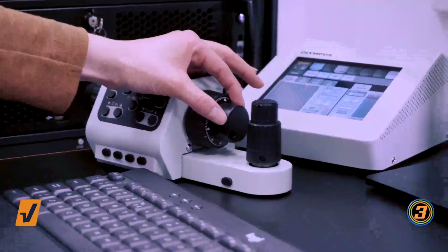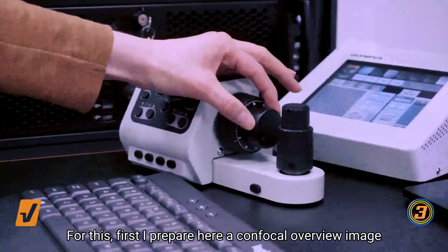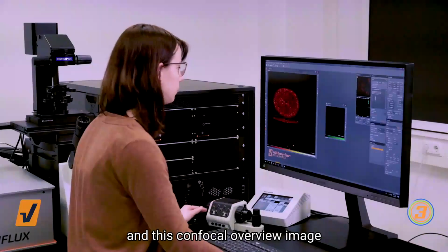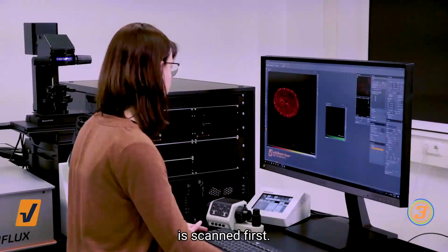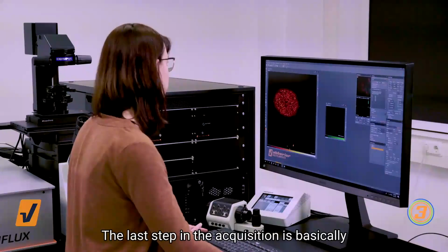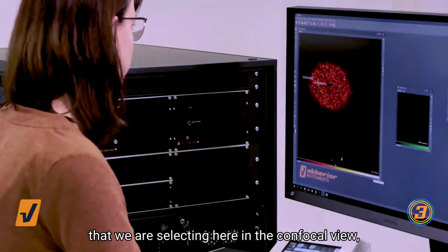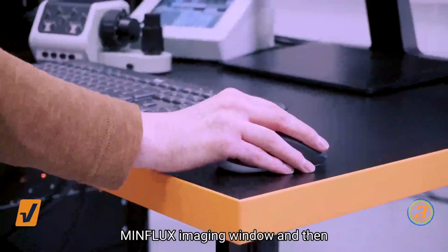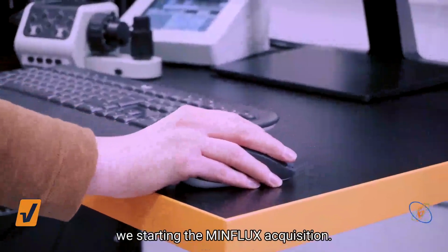For this, first I prepare a confocal overview image, and this confocal overview image is scanned first. The last step in the acquisition is that we select in the confocal view the region of interest, copy it over to the MINFLUX imaging window, and then we start the MINFLUX acquisition.